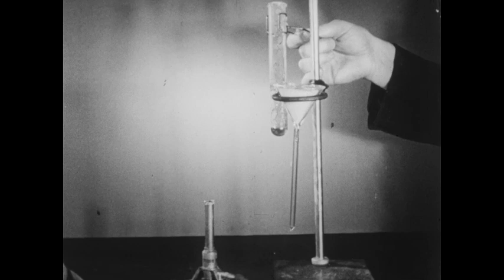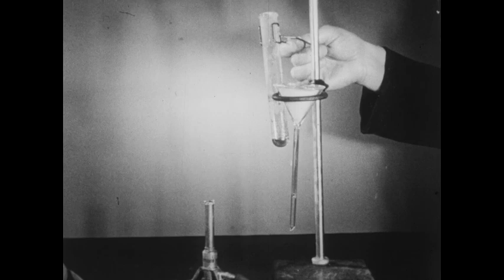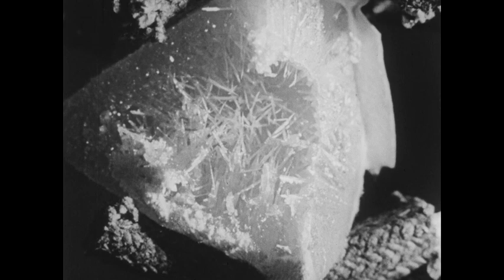We'll then permit the liquid sulfur partially to crystallize, and then we'll pour off the still liquid portion and examine the crystals remaining in the funnel. The liquid sulfur, which we poured into the funnel, cooled and solidified. But before it had completely solidified, we poured out the balance of the still liquid sulfur, leaving this mass of sulfur which had crystallized around the edge of the funnel.